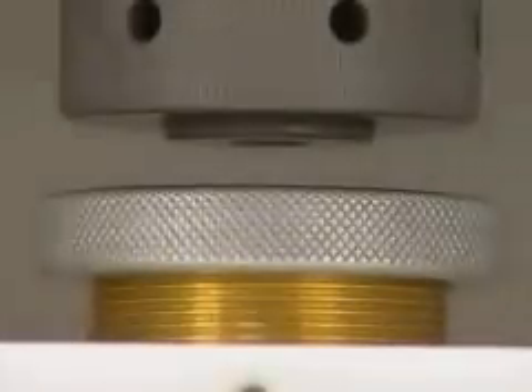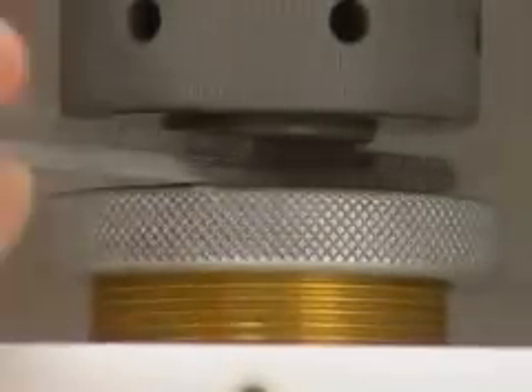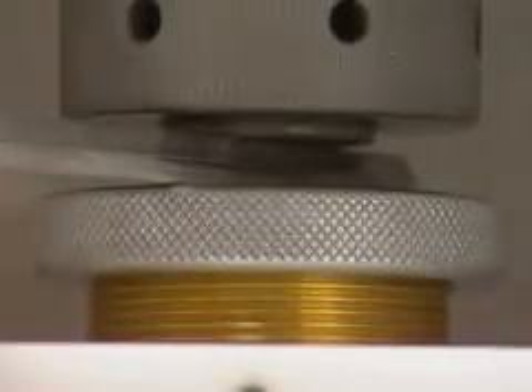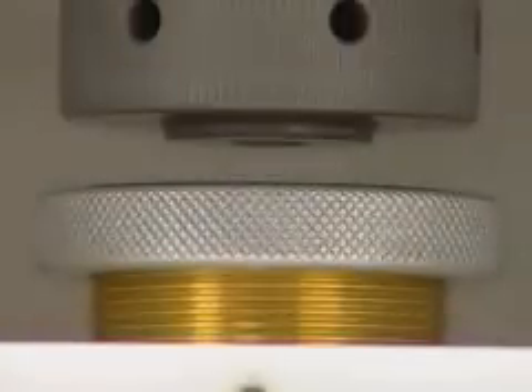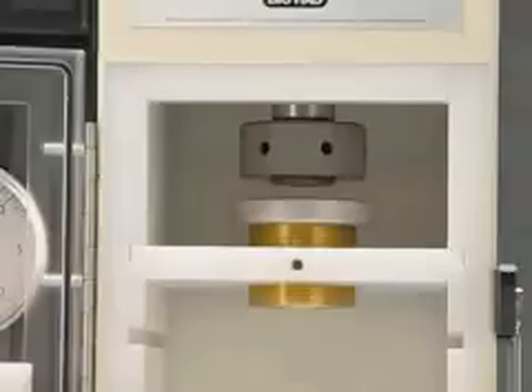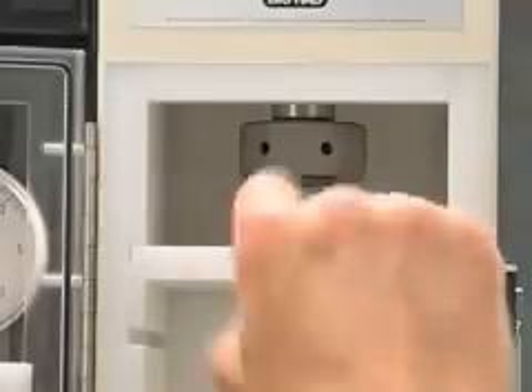Take the quarter inch hexagonal adjustment tool and place it into the gap. Turn the adjustable nest until the macro carrier cover lid touches the gap tool. Fix this setting by tightening the set screw.